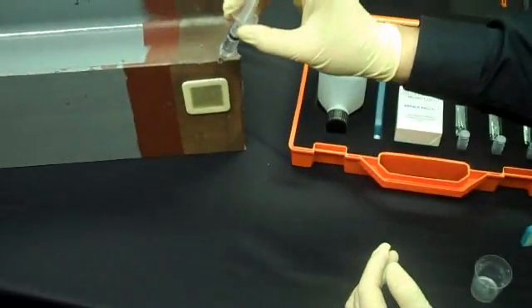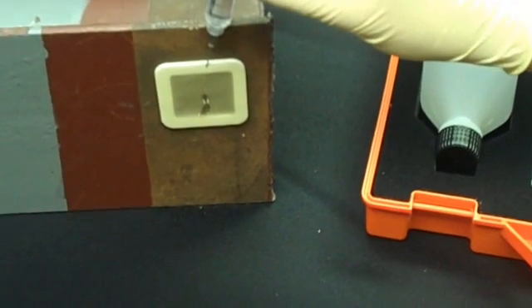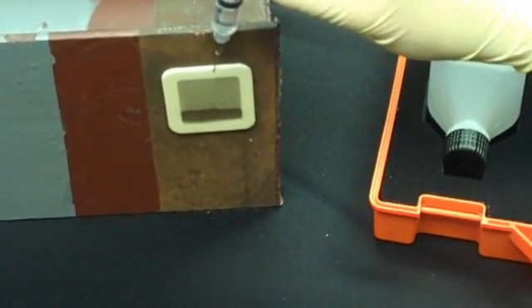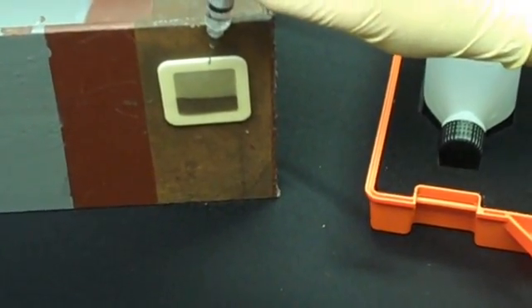Carefully insert the syringe into the outer area, and put about 1.5 milliliters, about half of the solution, into the patch.